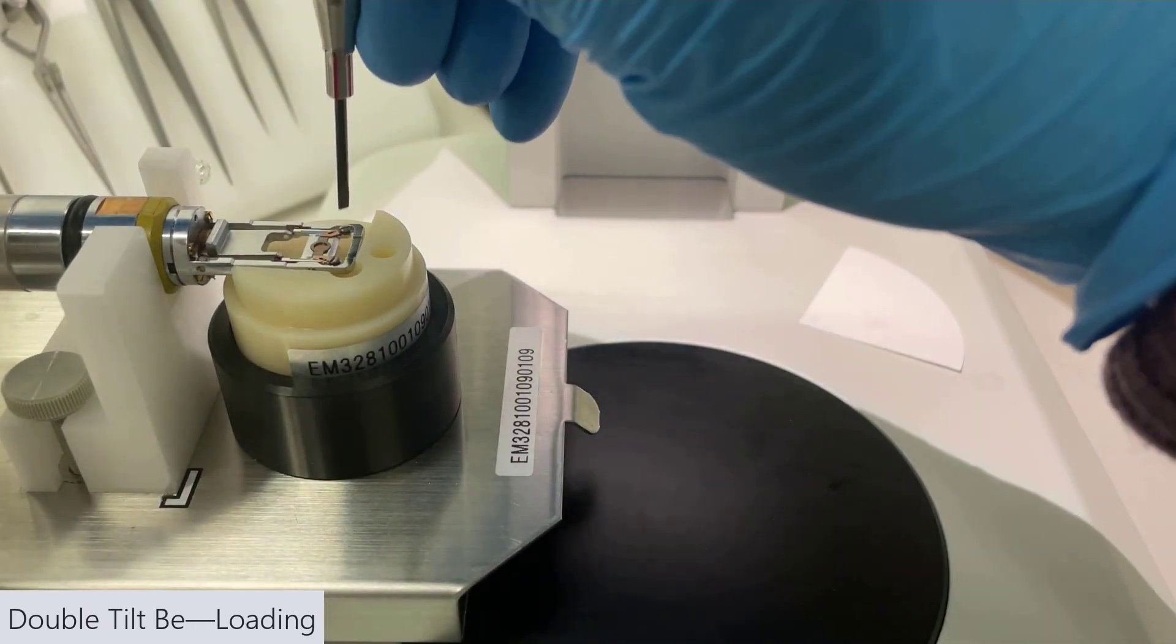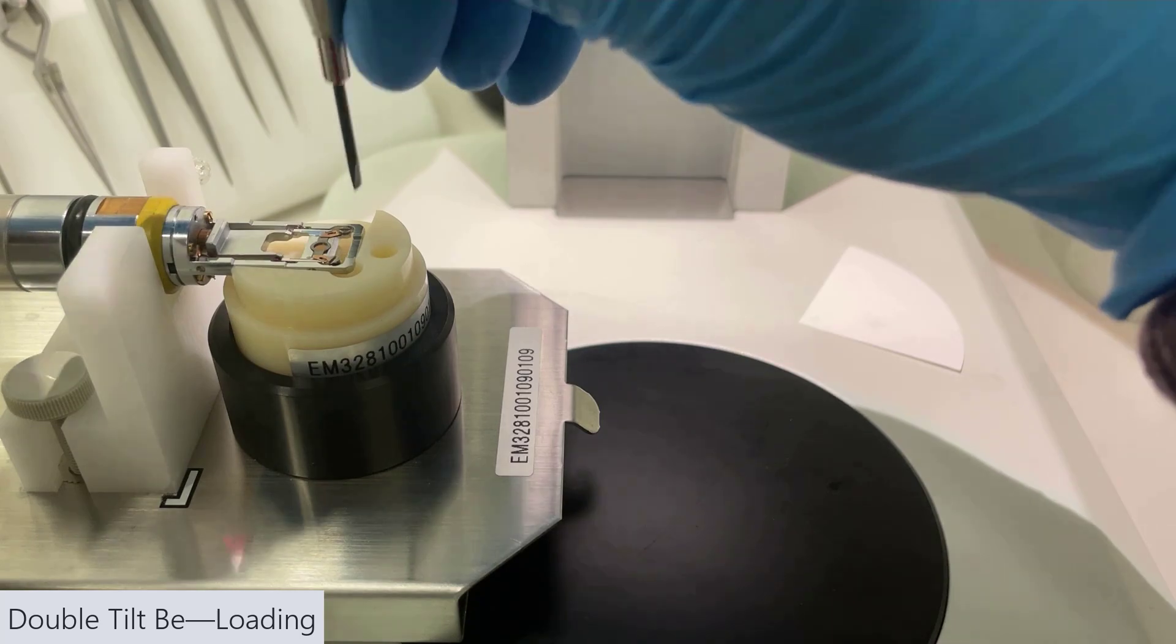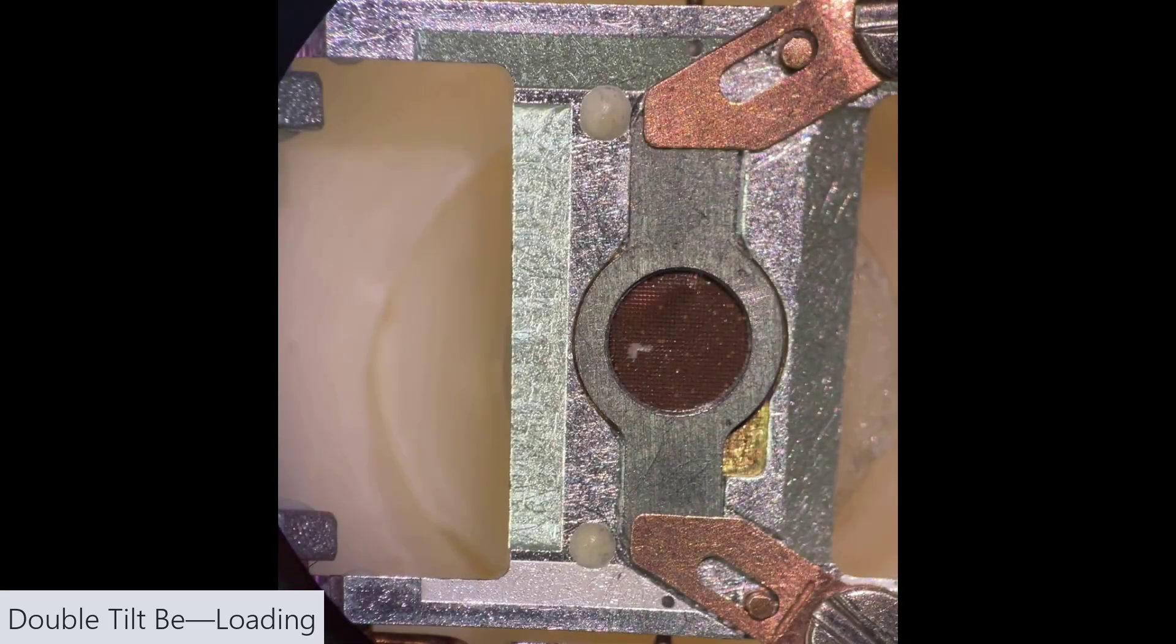and there are these little notches that these pins need to fit in, so make sure you do that. And this is a properly seated sample.